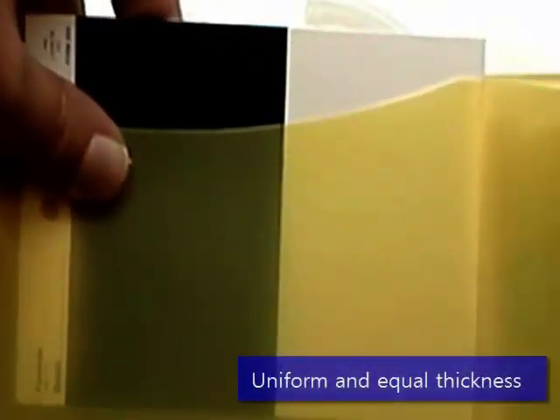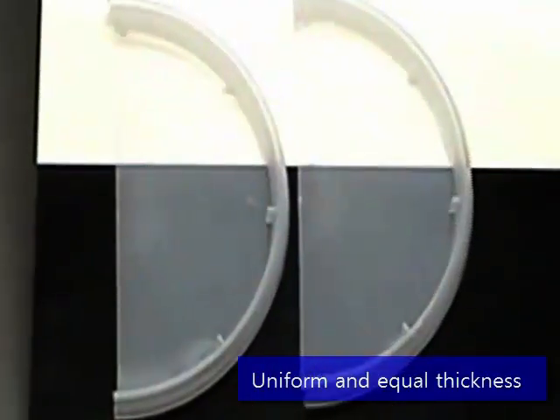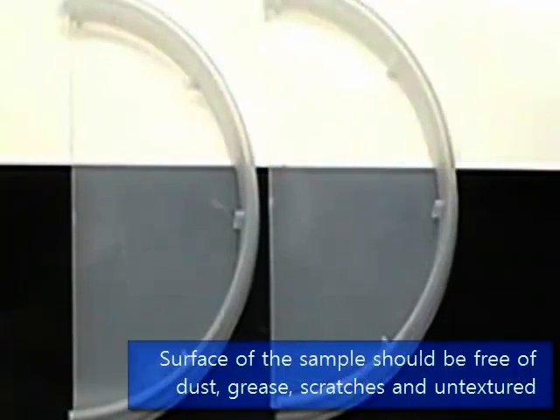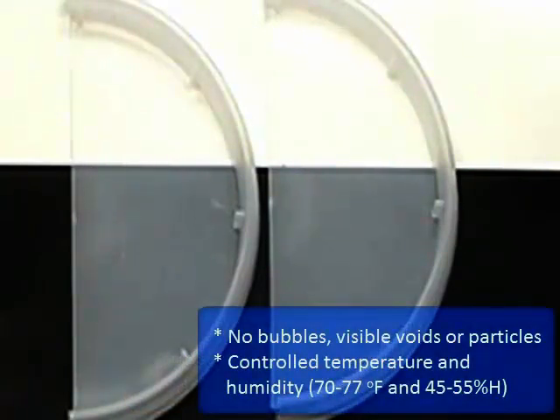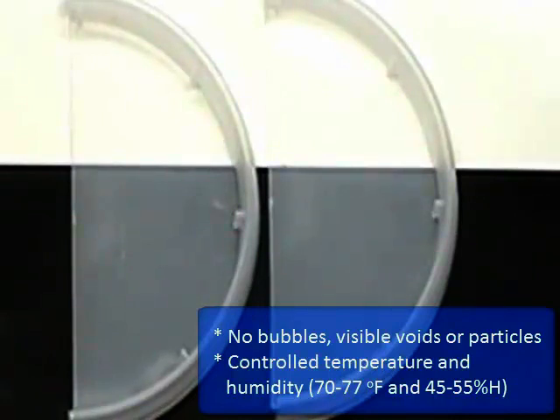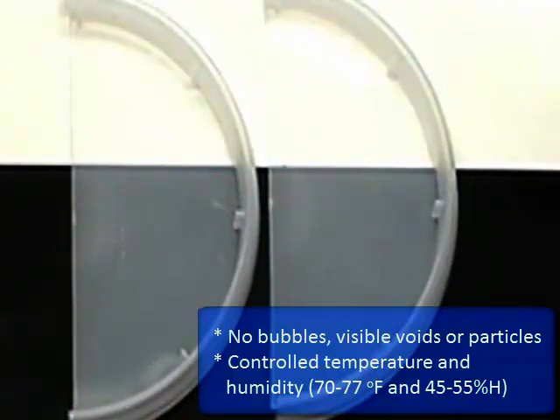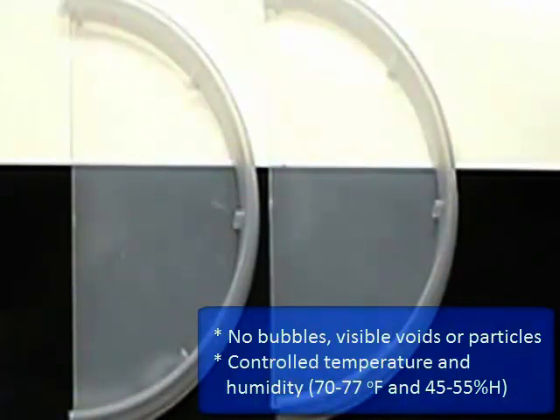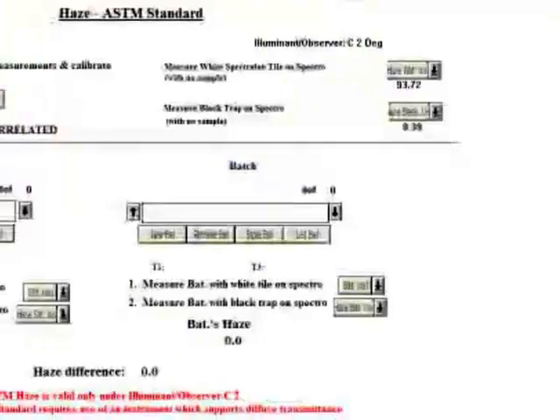Samples to be measured for haze should be of uniform thickness. If you are comparing samples, they must be of equal thickness. The surfaces should be free of dust, grease, scratches, and blemishes, and must be untextured. The interiors should be free of visible voids, bubbles, and particles. The samples and the room in which you are working should be at average temperature and humidity. The ASTM puts the temperature between 70 and 77 degrees Fahrenheit, with humidity between 45 and 55 percent.